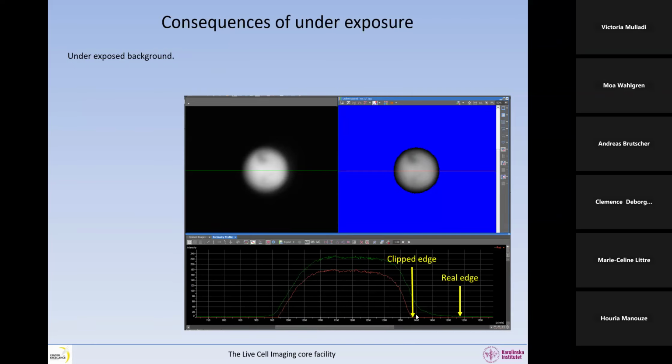So the edge is really clipped, and all the data here is completely clipped. That's why you see it's at 0. So we get no details at the edges. We get the wrong size as well.